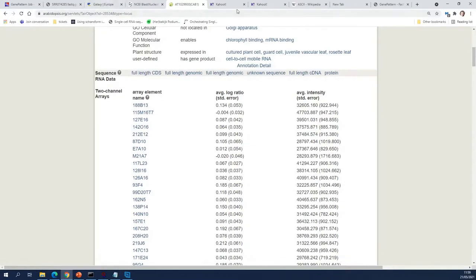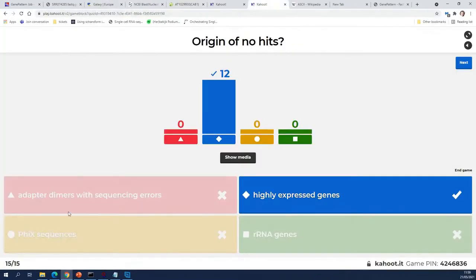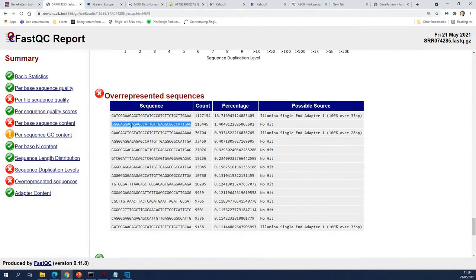So if you want to check whether it's an adapter dimer with sequencing errors, you have the sequence of the adapter. So you can make a sequence alignment between these two and see if they match. In this case they will not, because it's a housekeeping gene, it's not an adapter with extra sequencing errors.